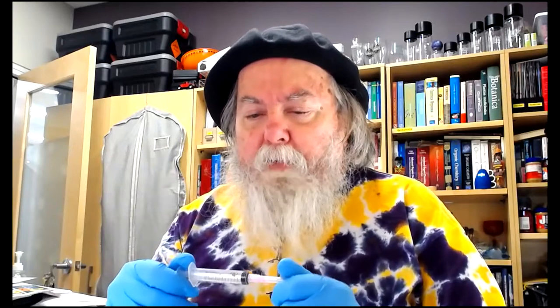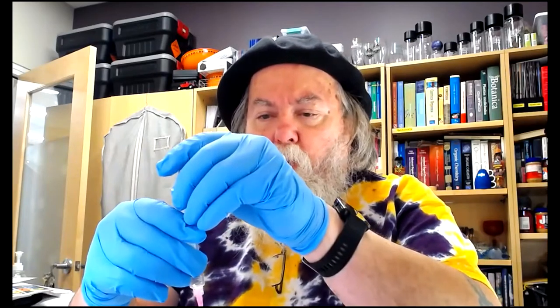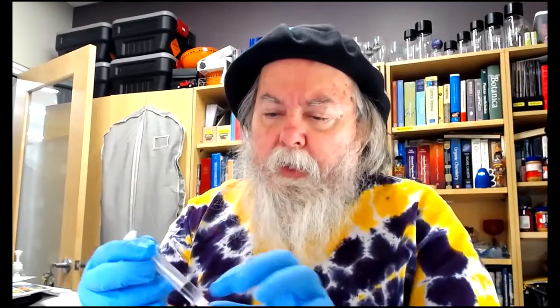So in each lab, there's only going to be one 1 mil syringe. That's sufficient for all of you to actually measure out the benzyl alcohol. I'm going to put out enough syringes for each person to use their own syringe. This is a 5 mil syringe. You're going to uncap this and very carefully pull up 1.5 mils. You can go a little bit over if you want to, but don't go over too much. But pull up 1.5 mils of concentrated nitric acid.